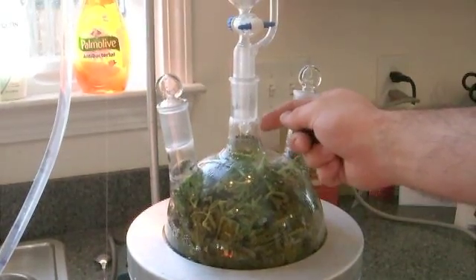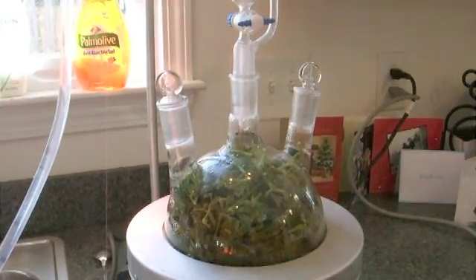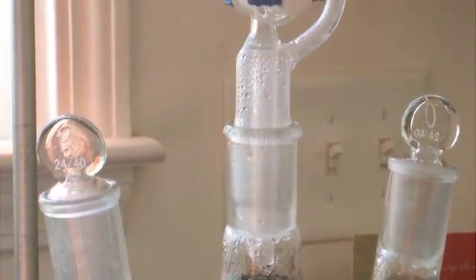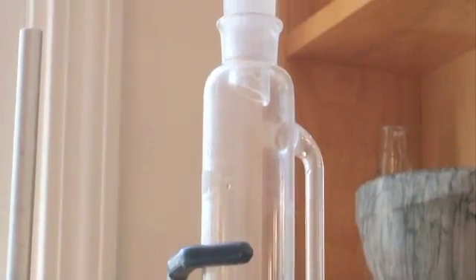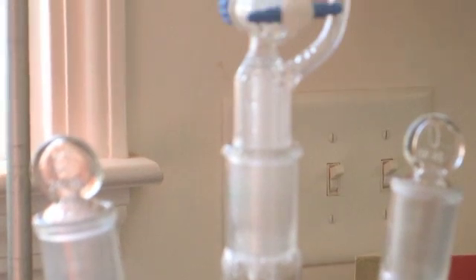Once again, ensure that there is nothing blocking this aperture here. And here's the condensate — it's starting to get into the bypass there. It's got to go all the way up there to the condenser at the top. There it goes.